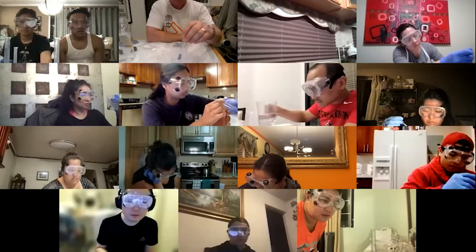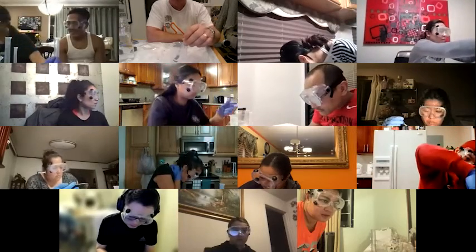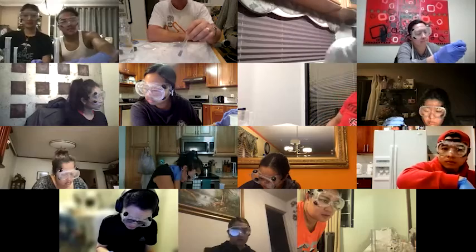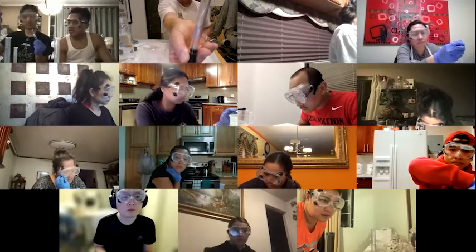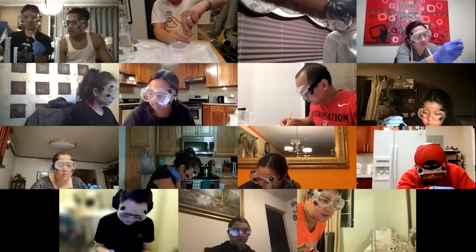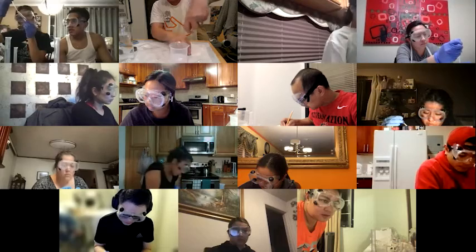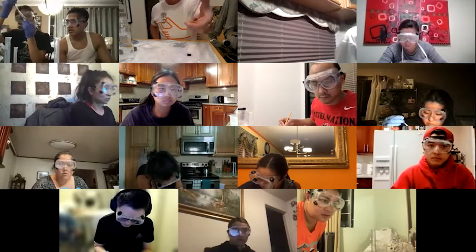All right, so this thing is now done because all the hydrogen's been pushed out. I still got plenty of metal in there. Maybe I could try it again. So you see that my tube doesn't have any liquid in it. The gas has pushed all the liquid out. I just put my finger over the bottom of it and basically trap the hydrogen gas inside.